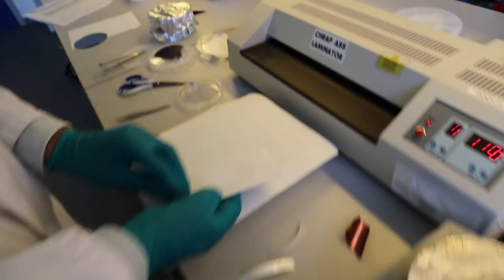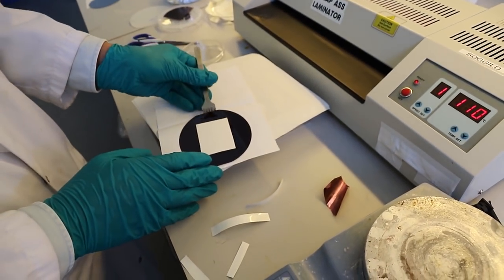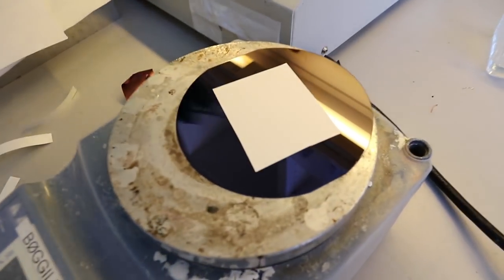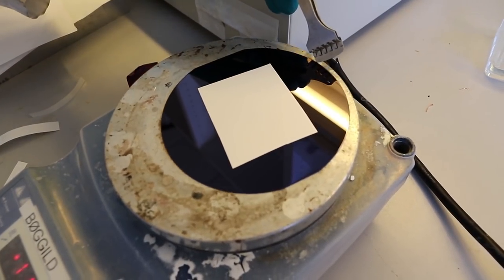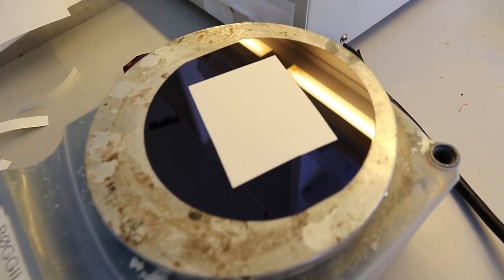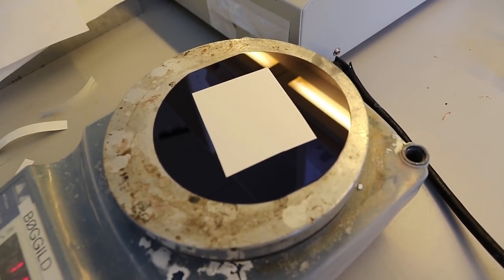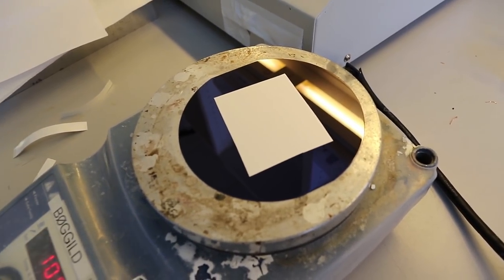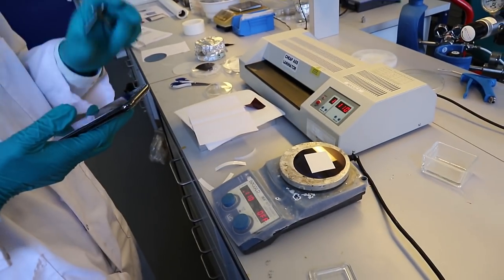It is done now. So now we just want to give it a final bake on the hot plate for roughly one minute. That's your second cup of coffee then. That's my second cup of coffee, exactly. Or just in time for a YouTube video.